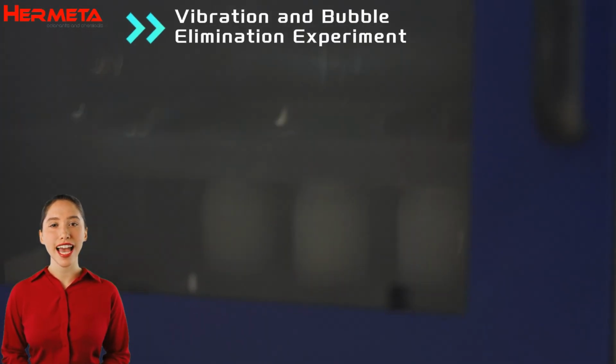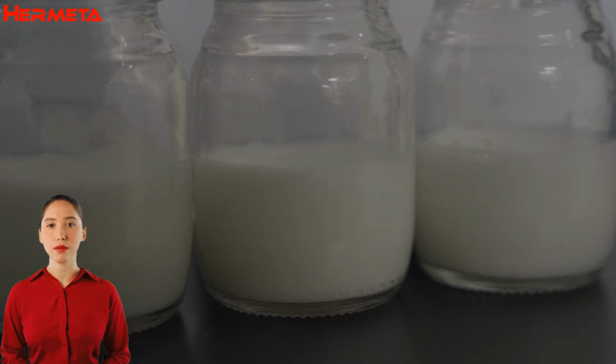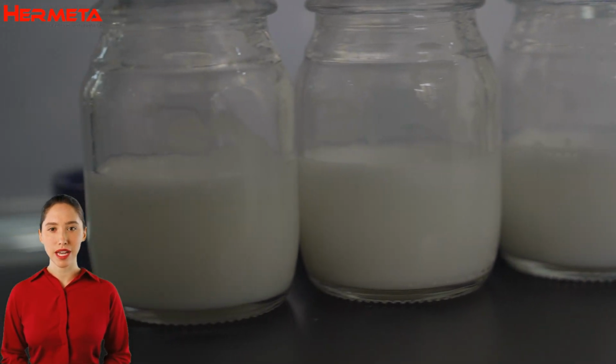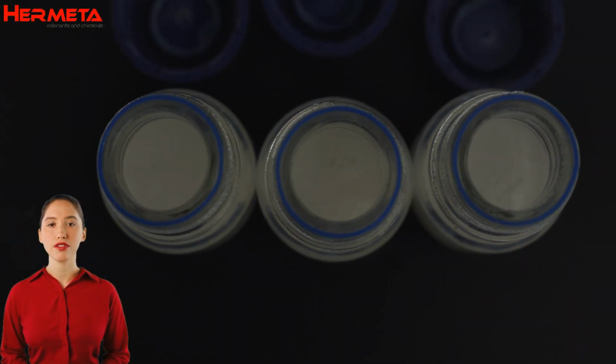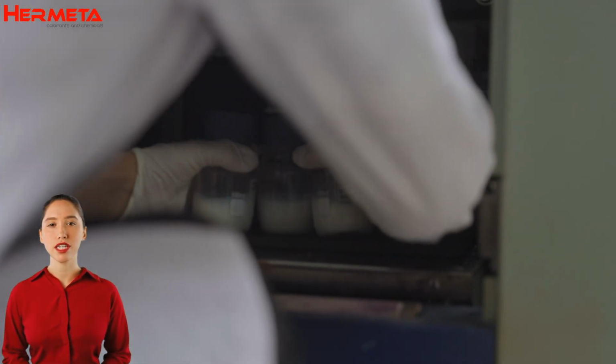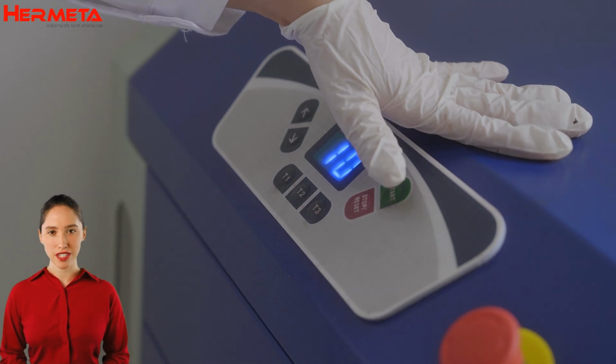The vibration and bubble elimination experiment simulates the vibration of the pigment in the process of use and observes whether the bubbles generated are easy to dissipate, which has a direct impact on the surface effect and application stability of the paint. Pigment samples are put into a vibrator. Specific vibration parameters are set and vibration is started.